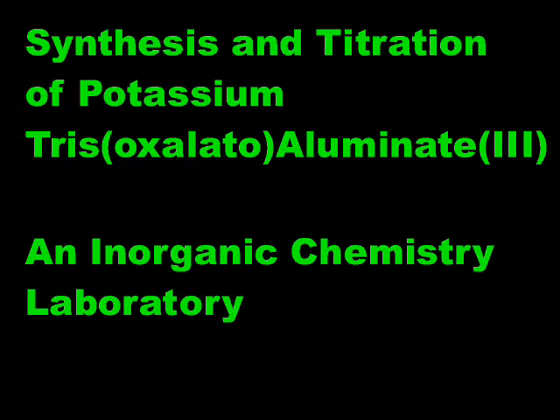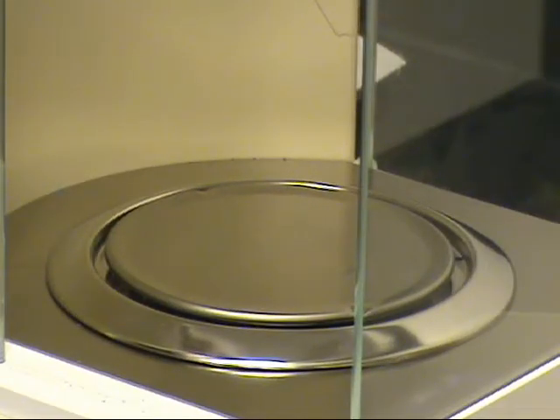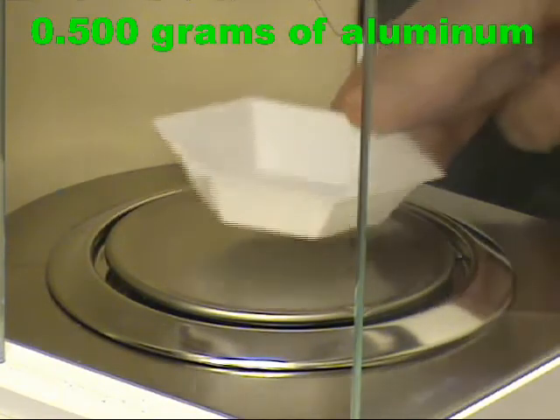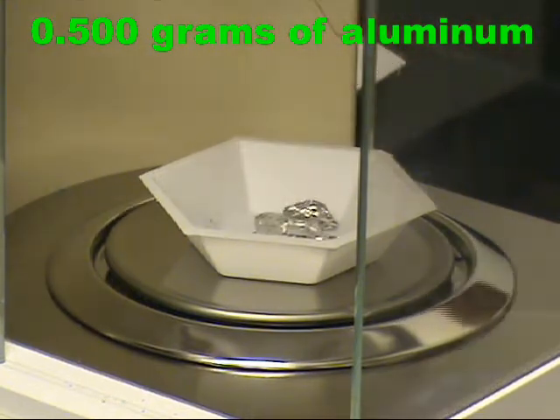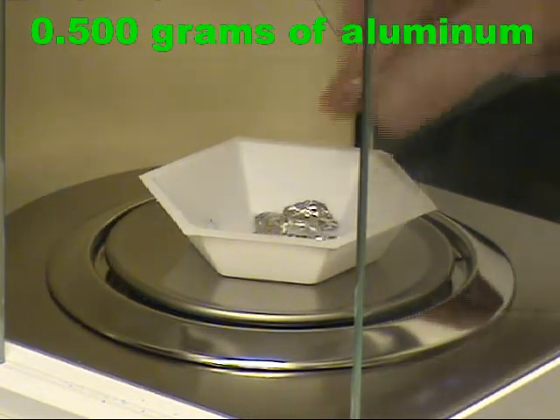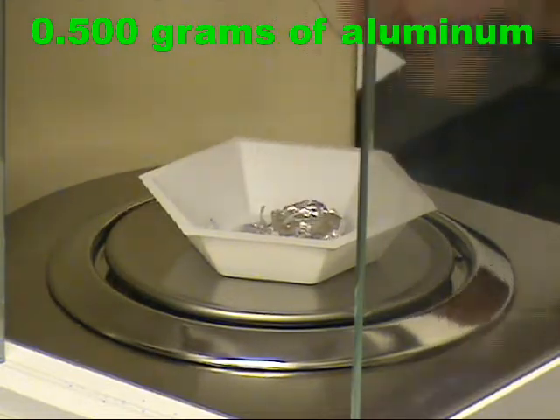In this lab, we will perform the synthesis and titration of potassium tris oxalato aluminate trihydrate. In the first part of the synthesis, you will weigh out 0.5 grams of aluminum. Your source of aluminum is ordinary aluminum foil, which is torn into small pieces.